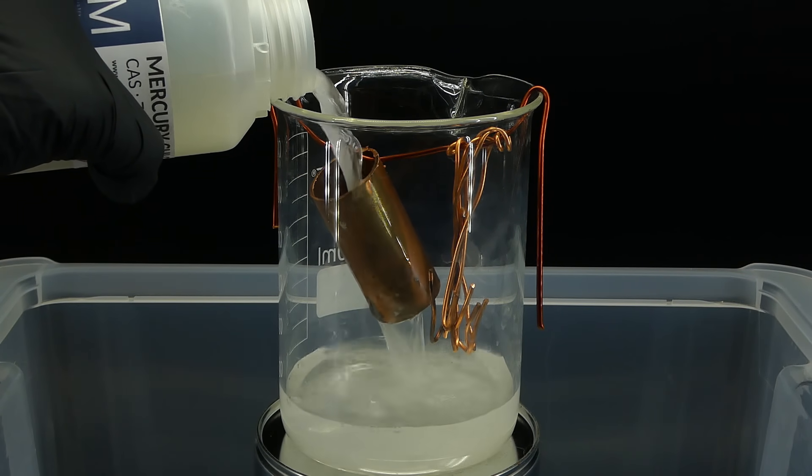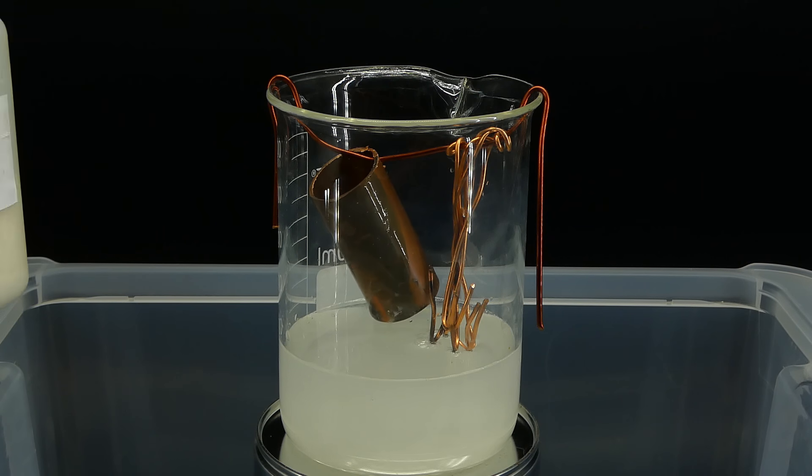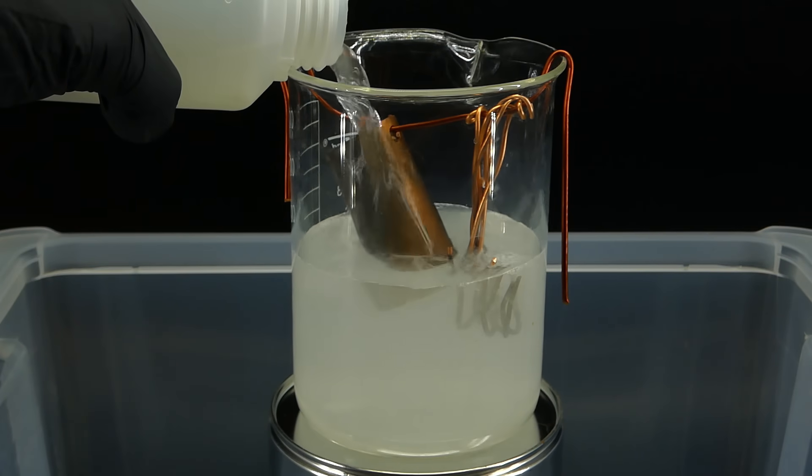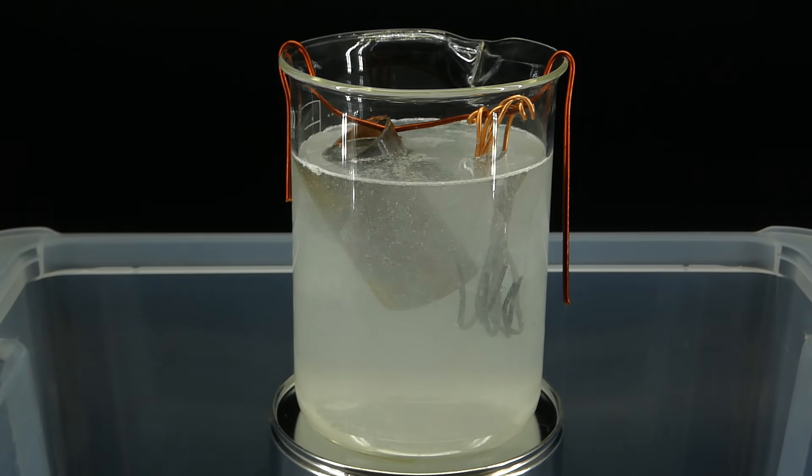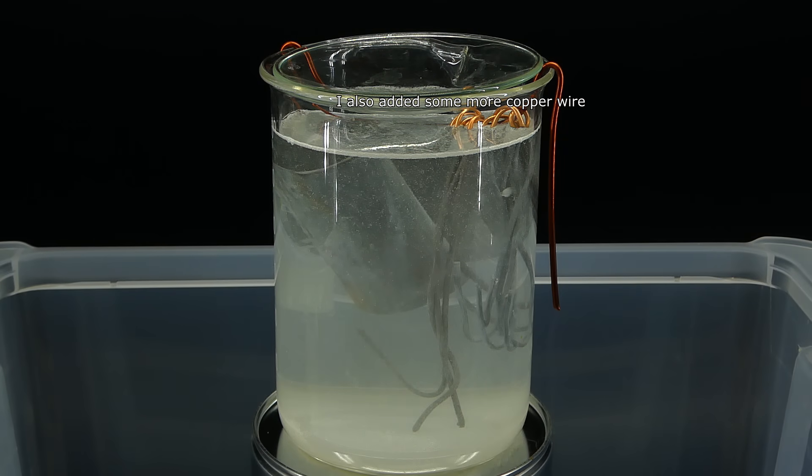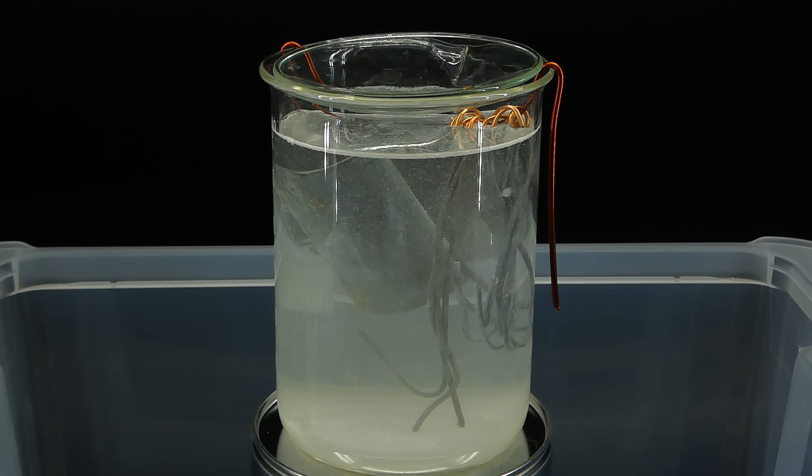After pouring in the water, I capped the container and nervously shook it to make sure that the solution is saturated. I then poured it into the contraption, and immediately, the copper took on a silvery tint. I repeated this process a few more times to get all of the copper submerged, and by the time I had finished doing this, there was a nice layer of something silvery on the copper's surface. The reaction going on here is just a single displacement. The copper reacts with the mercuric chloride to form copper chloride and elemental mercury, which should fall as some shiny droplets when enough is made.